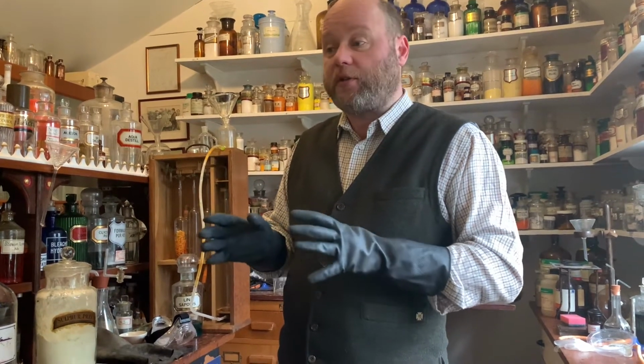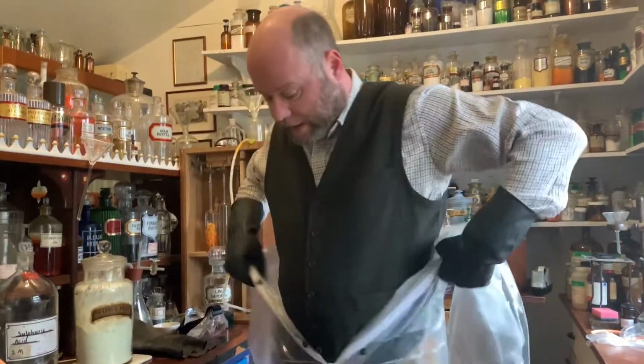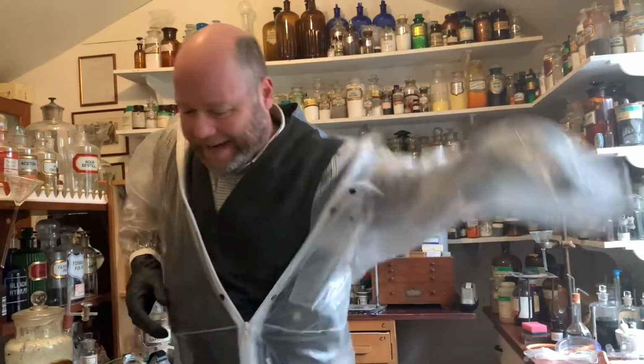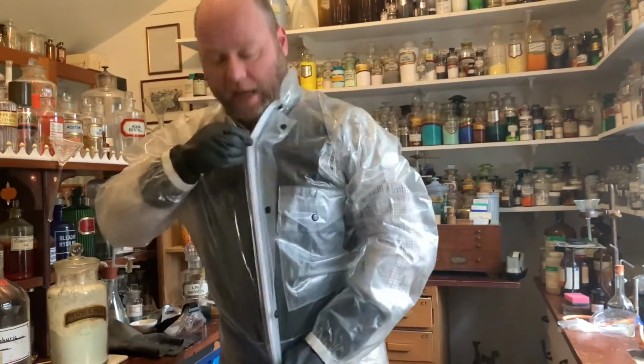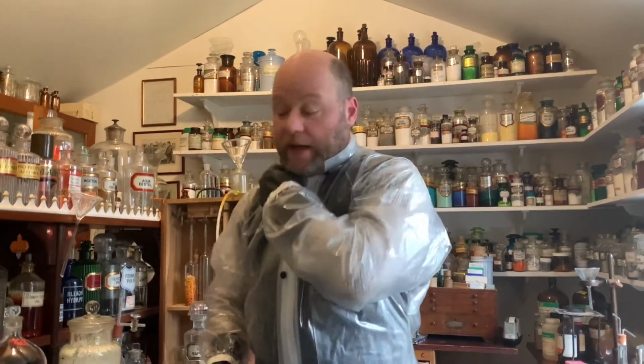Now, concentrated sulphuric acid is used in numerous places in industry, from fertilizers to explosives to oil refining and in plastics. And to use concentrated sulphuric acid, I'm going to don my plastic suit myself. And I've got a pair of very thick rubber gloves. And that is because it's not a fashion statement, it's to protect my clothing. Because we're going to see what happens if sulphuric acid was splashed onto clothing or skin.